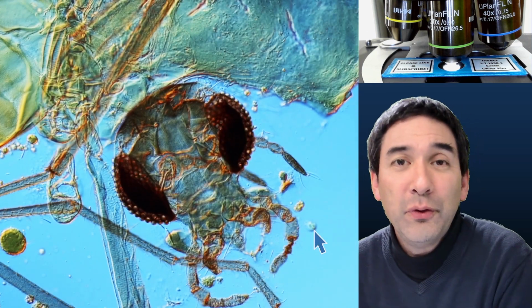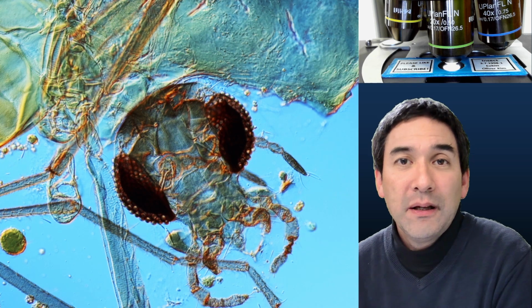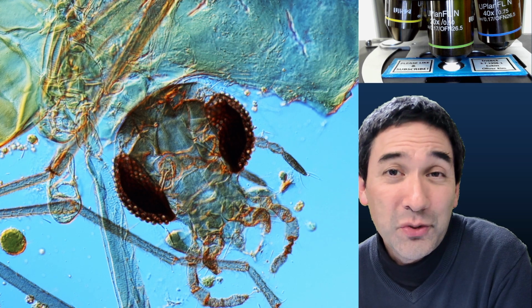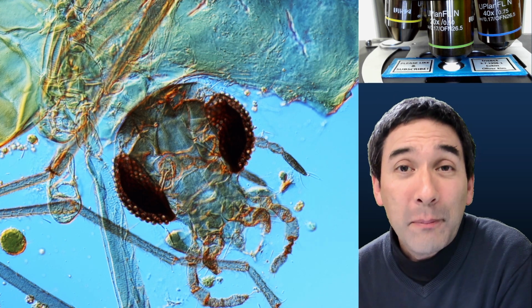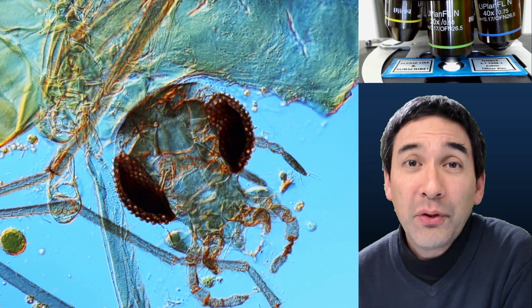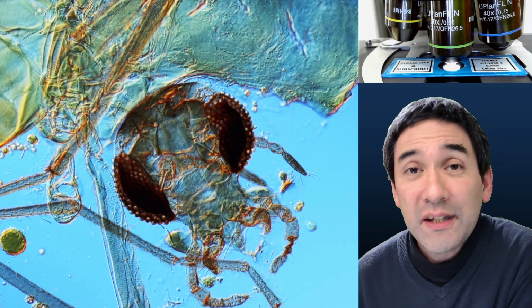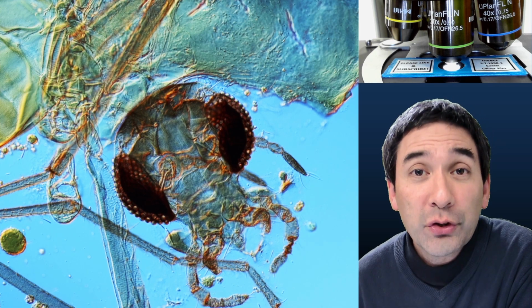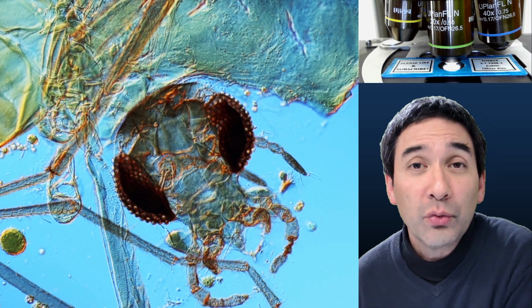I would do a few things differently this time if I were to make another insect mounted slide, and I would like to share this with you. And the first thing that I would do differently is I would probably not mount the complete insect. I would actually first take it apart and mount the wings and the legs and all of the body parts separately, because this way they're much thinner, and this way they also cannot be crushed quite so easily, and therefore they preserve their original shape better.